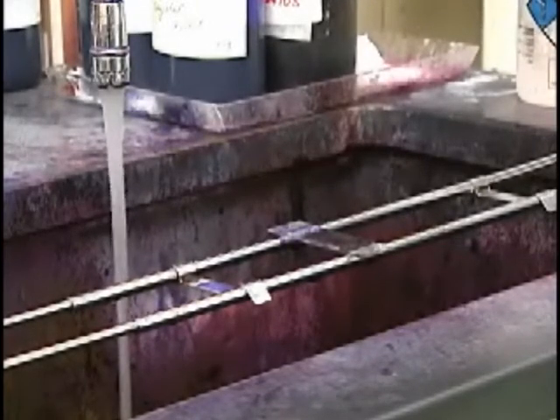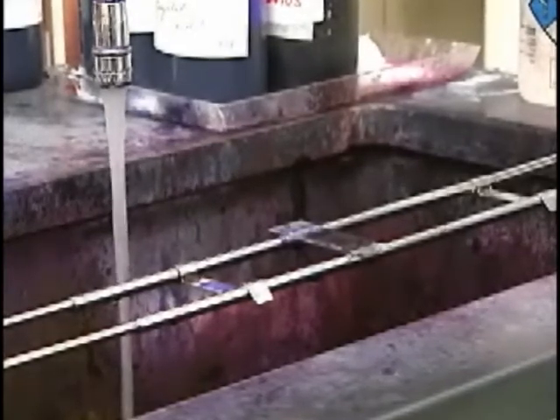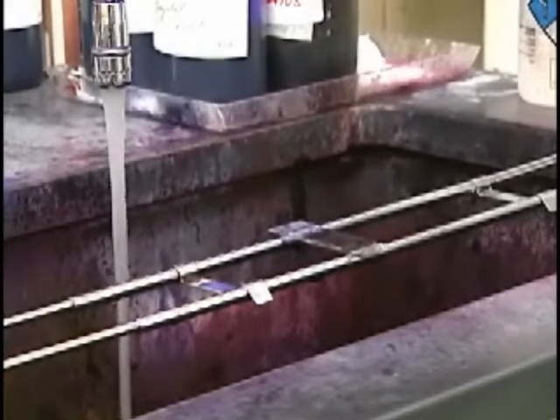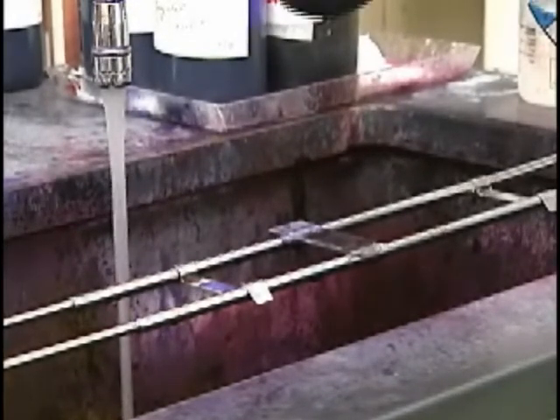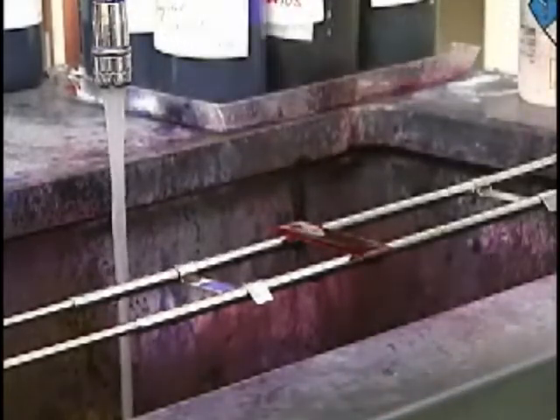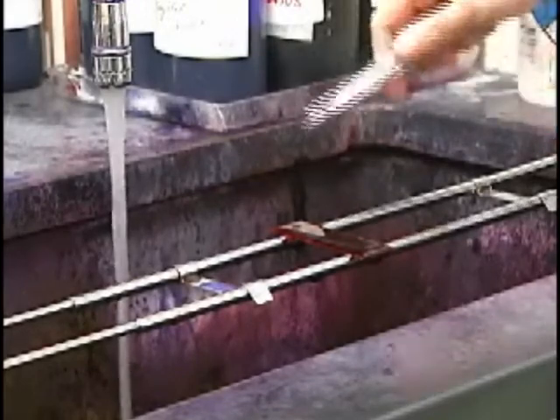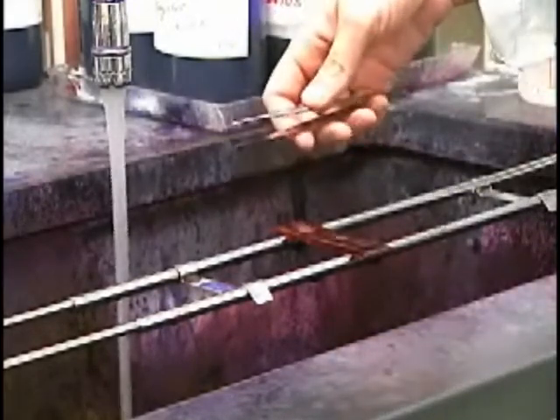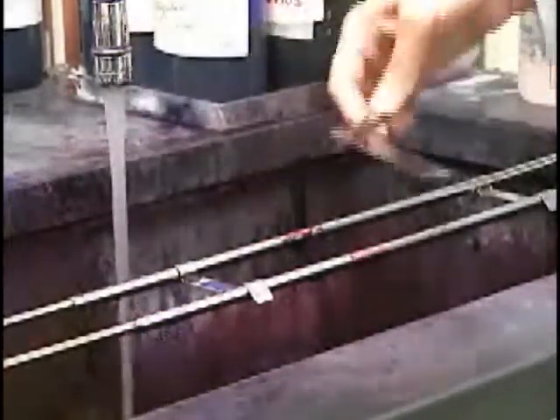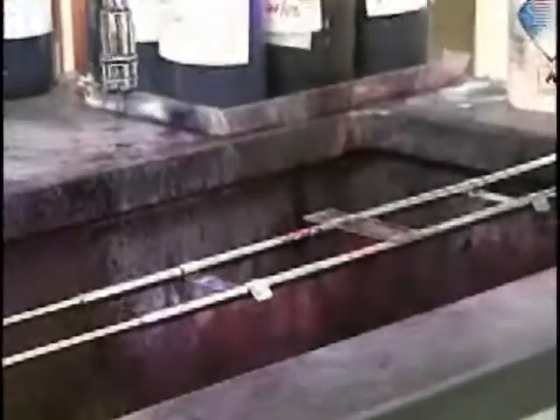This is a really important step because it's one of the fundamental characteristics of determining whether an organism will turn blue or turn pink. Thick-walled bacteria that turn out to be gram-positive retain that crystal violet-iodine complex in their thick cell wall. If you don't have a thick cell wall, when you put that acetone on, you'll actually remove the stain from the bacterial cell wall. So that doesn't have any stain right now. Now we put on the counterstain — the safranin — so that we can stain anything that was decolorized or had not already taken up the stain. This stays on for 10 to 60 seconds, then can be rinsed away, and then we dry it. Now we can look at it under the microscope and see if we can identify any organisms.